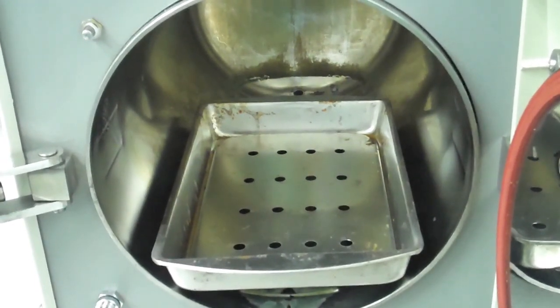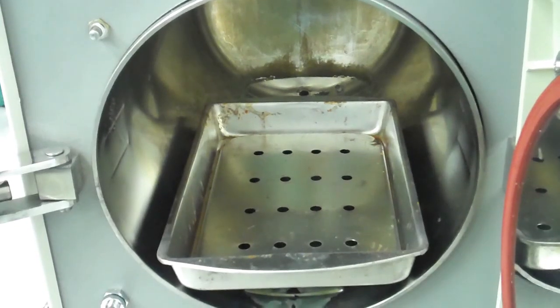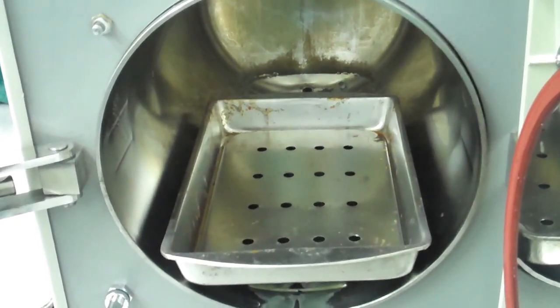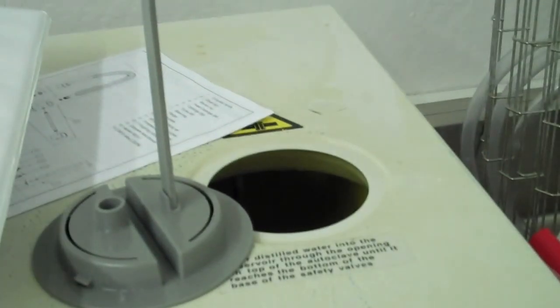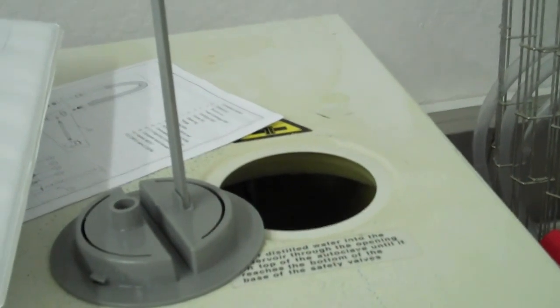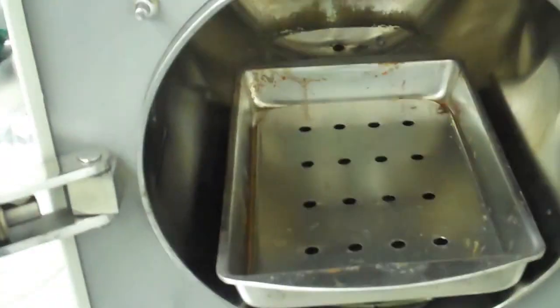You don't want gel to escape into the base of the chamber. That will actually cause the reservoir over here to fill with gel and become non-functional, just a terrible mess.